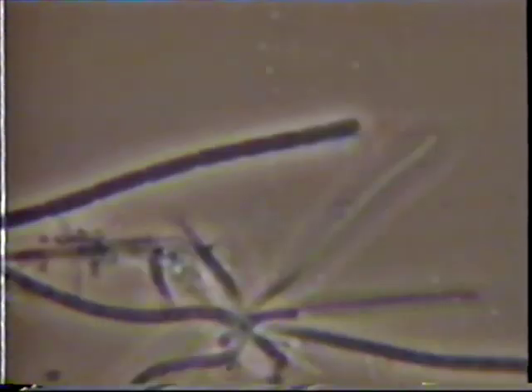Thiothrix may also have sulfur granules within their cells, shown here as bright spots in the filaments at 100 power under a dark field illumination. This filament has rectangular-shaped cells and a thin sheath, usually not observed. It may also have terminal sausage-shaped cells, termed gonidia, which are reproductive cells. These are Gram-negative and Neisser-negative.